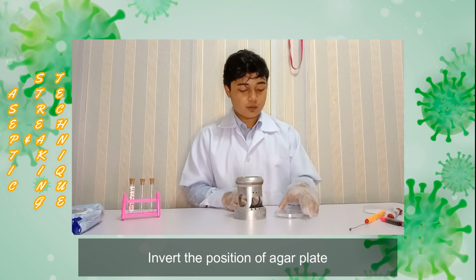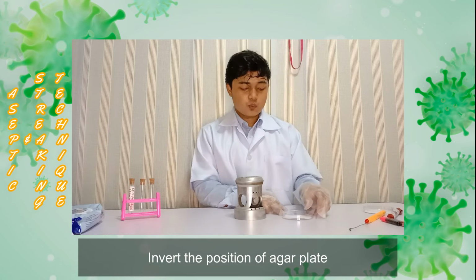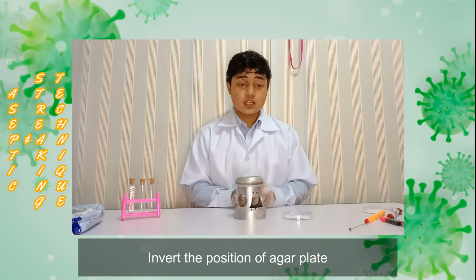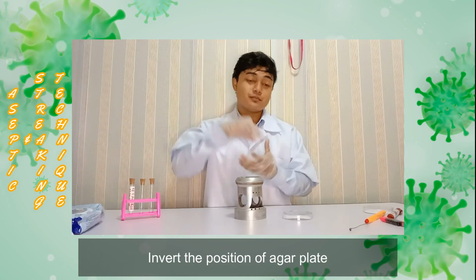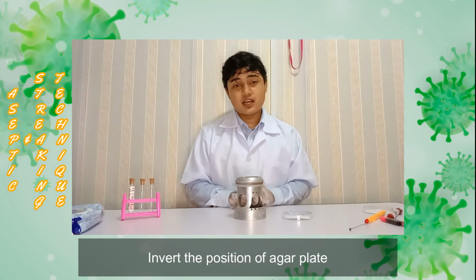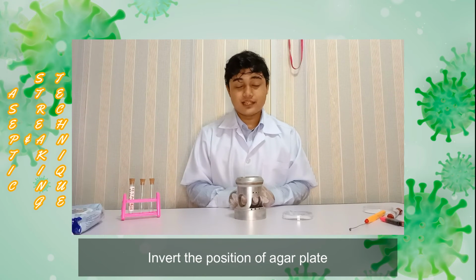After we finish everything, we need to position our agar plate in an inverted position. The reason why we invert our agar plate is to prevent the water that condenses on the top of the cover from dropping on the agar plate, to avoid contamination of our agar plate.